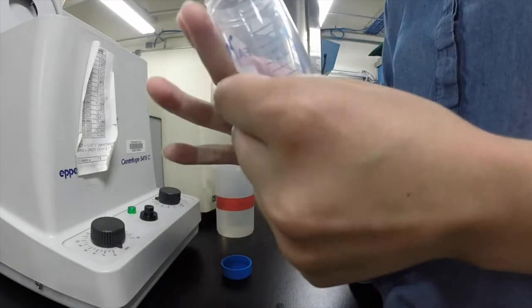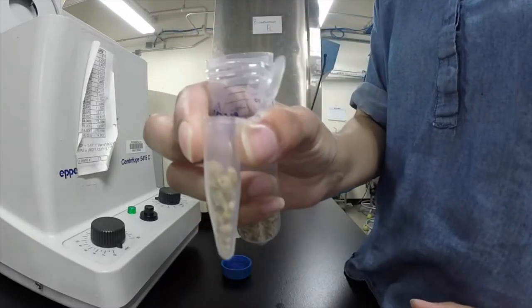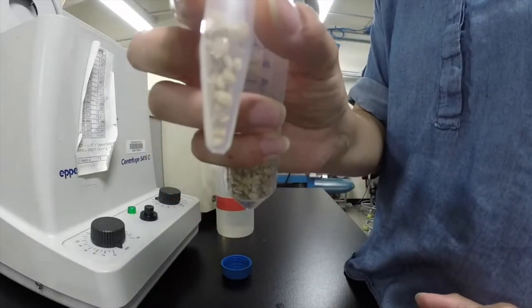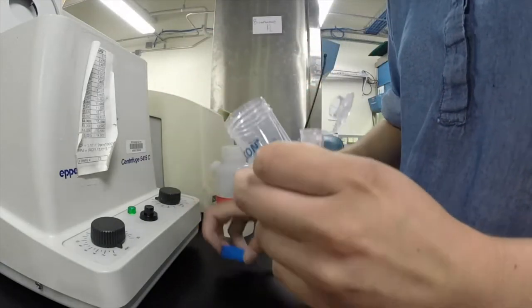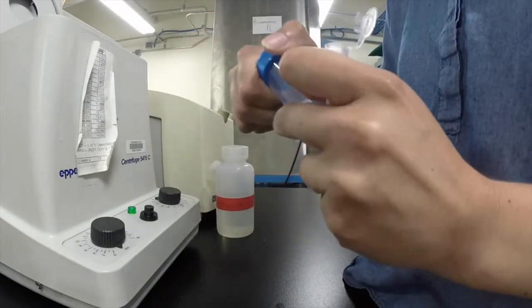I made sure to put plenty more seeds than I needed in here, about halfway, because usually you do lose a few during the sterilization process. We want to make sure we have plenty.